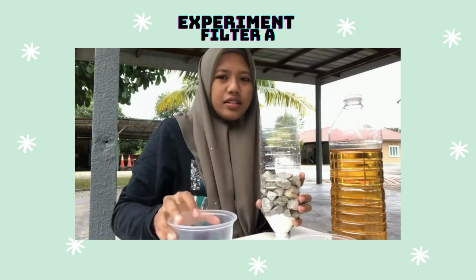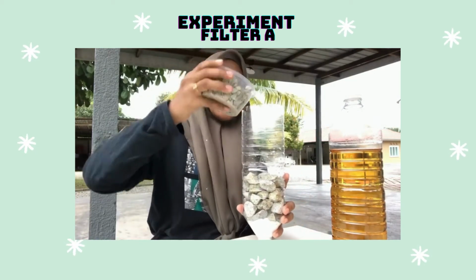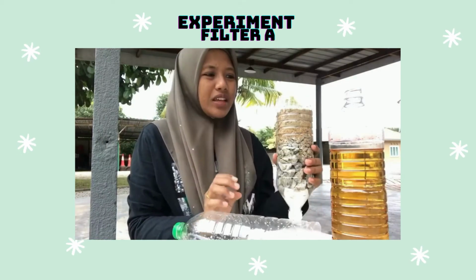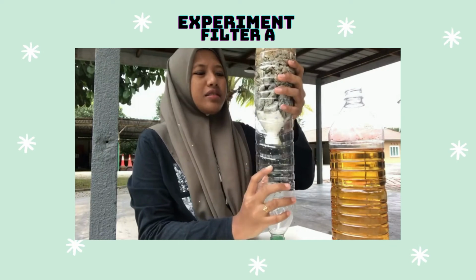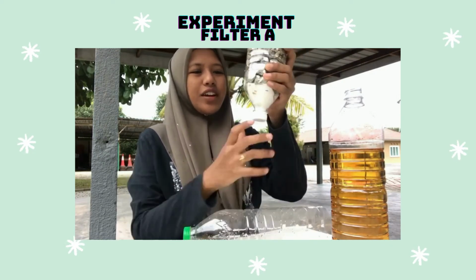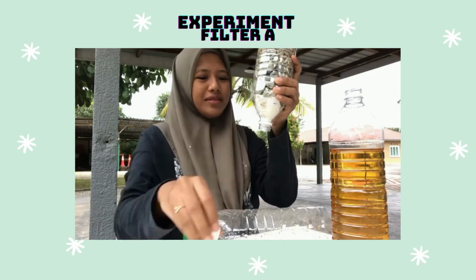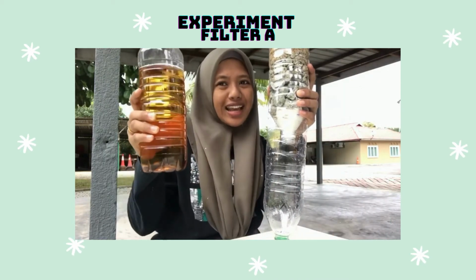Then we put fine aggregate around 3 cm. We will put it on the empty bottle, and don't forget to open the cap. Open the cap, put it on the empty bottle, and then let's do the experiment.